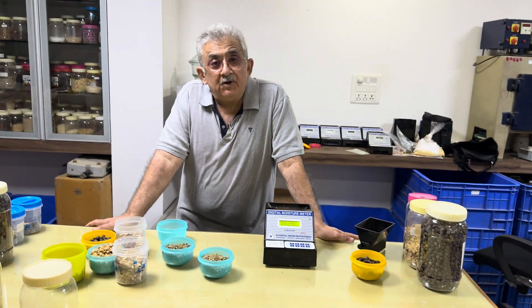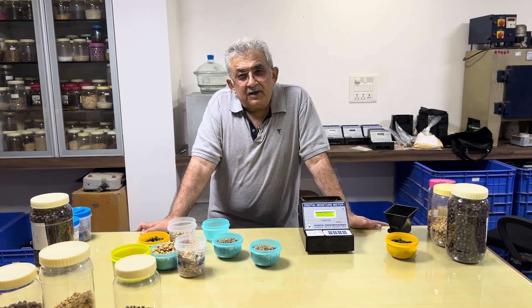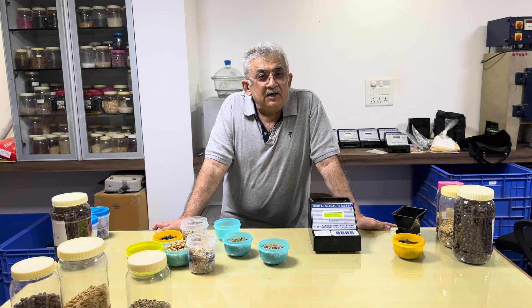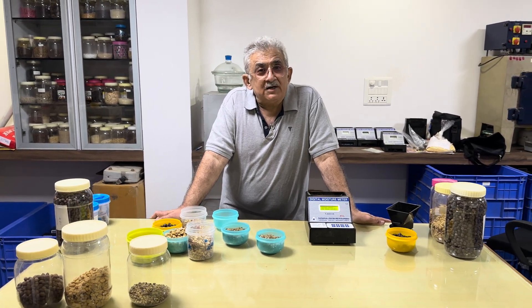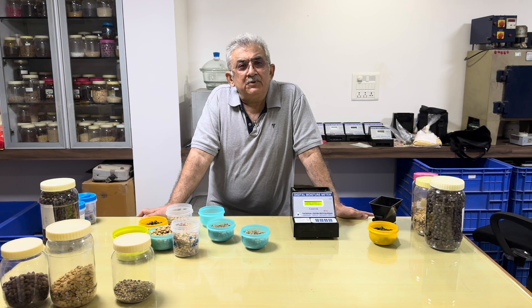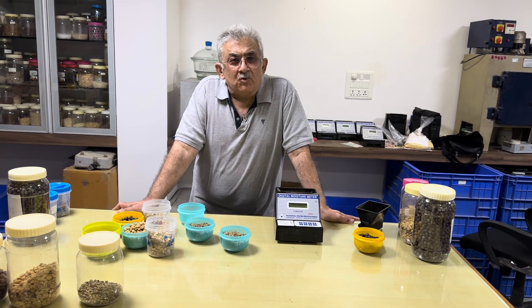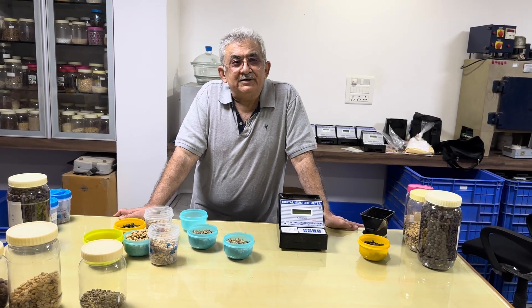Now for these 3 forms of coffee we have seen the moisture content. Normally it is desirable that if you get around 10% cherry moisture, you will find around 9% in parchment coffee and around 11.5% to 12% in coffee seeds. Coffee seeds sold in the market and exported should ideally have 13% moisture or below — 13% is considered good quality for export. It is also good for storage as it gives a long shelf life, after which people roast and use it.